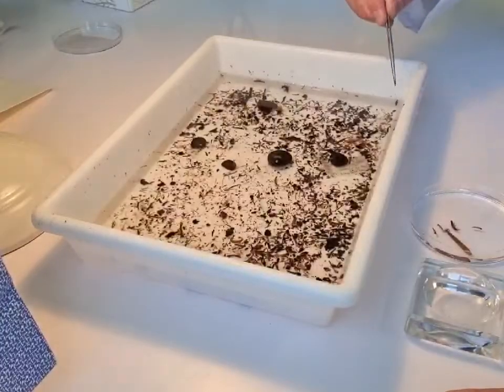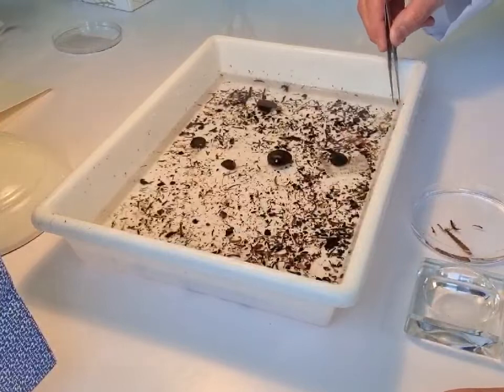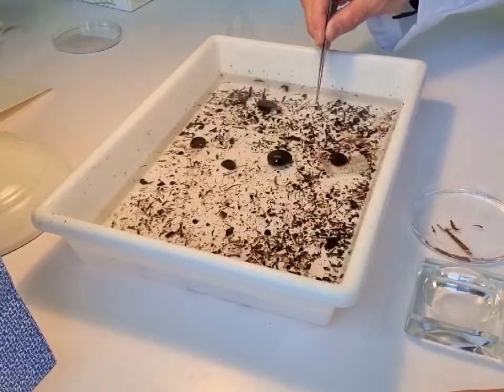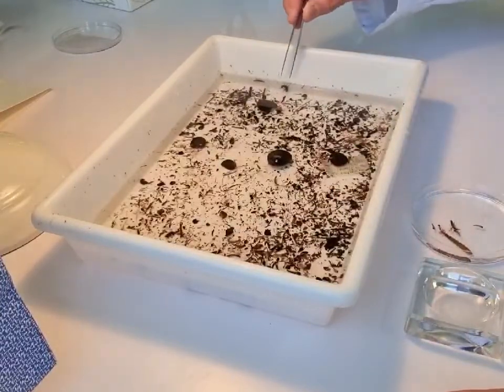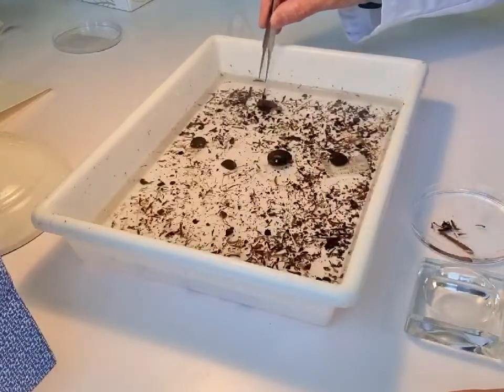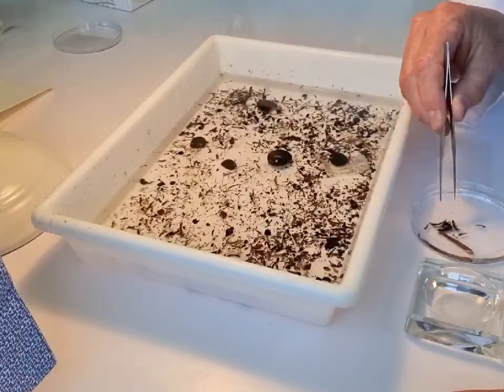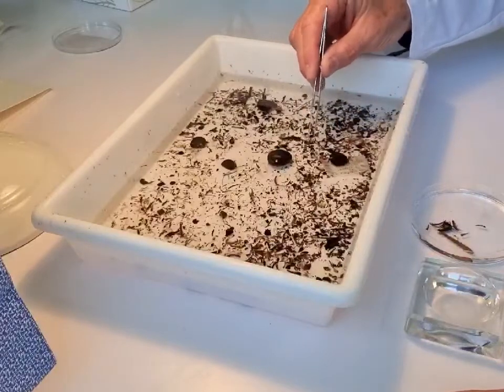We now have our sample ready to sort, and there are a number of different ways you can go about sorting samples. You can pick the biggest animals first, you can start in a corner, or you can use fixed-count methods. When you're sorting you might want to put your animals in trays to fit the types of species that you think you've got.